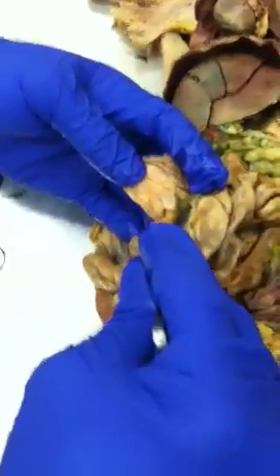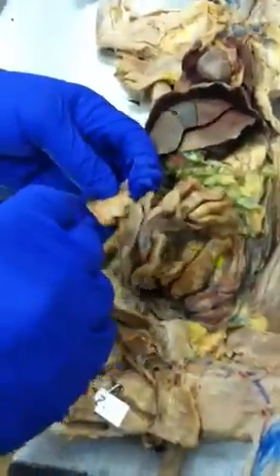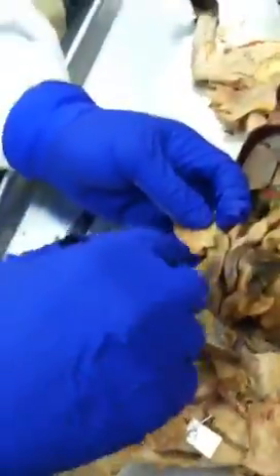You see? So if I put a pin here, then you say ileum, right? So I make it very obvious like that. A pin close to the stomach would be duodenum. A pin close to the colon would be the ileum with an E. And a pin anywhere around in these parts would be the jejunum. All right? We are clear on that, right?